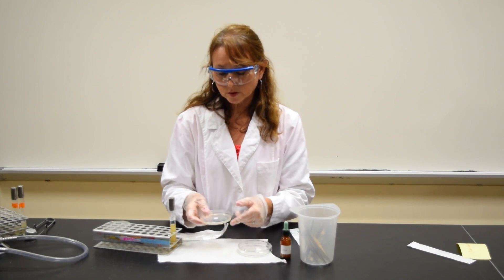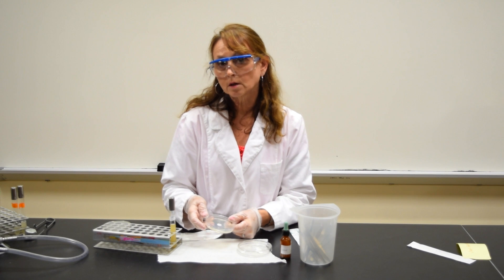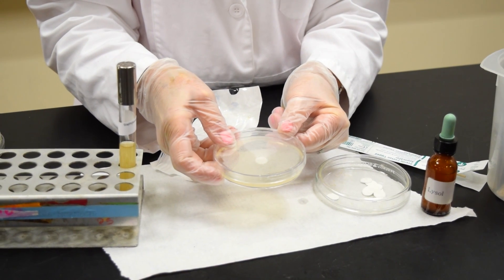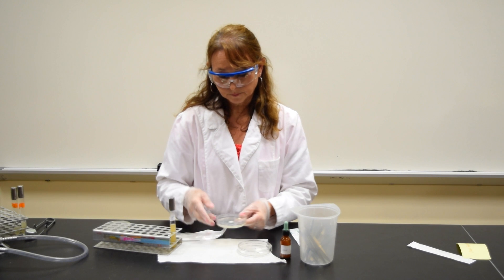I would do this with my remaining plates, testing the other organisms and chemicals. This plate is then placed into the incubator.